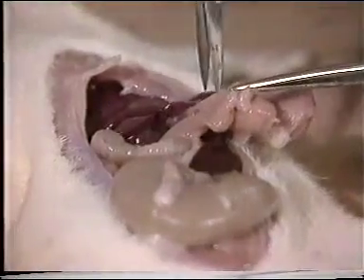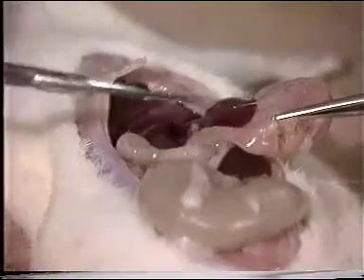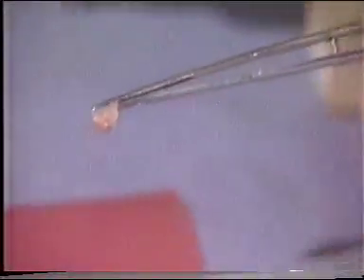However, electrons have a much shorter wavelength, and if we use electrons as the illuminating source in an electron microscope, we can obtain much higher resolution and therefore much greater magnifications. This glass slide is not, however, much use in an electron microscope, so I'll have to start with a fresh piece of pancreas. A small piece of tissue is removed from a rat and placed on a wax block.